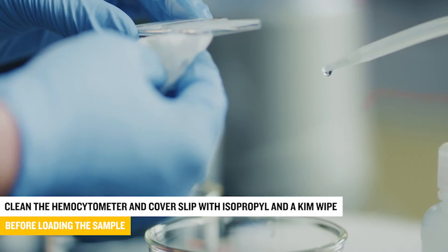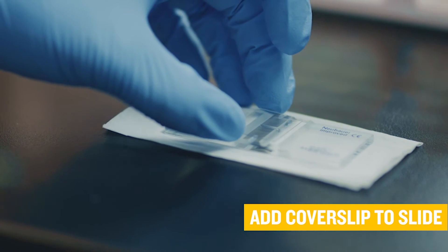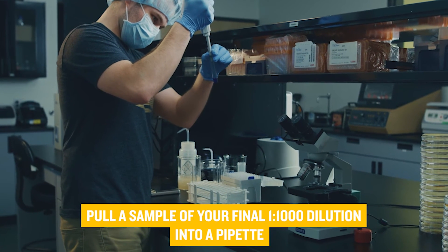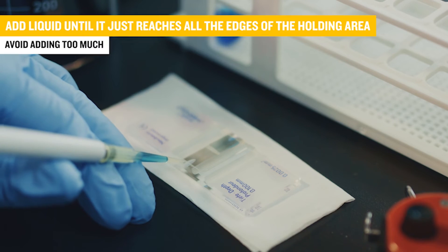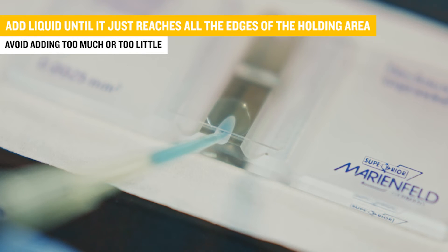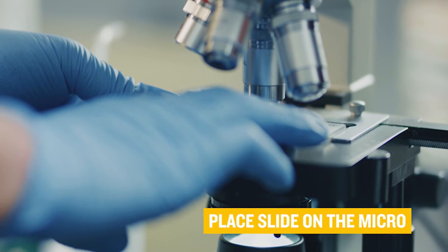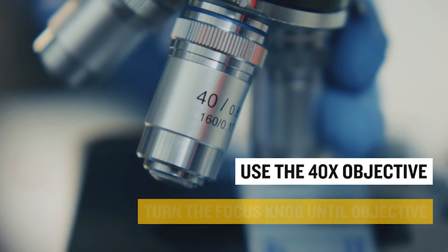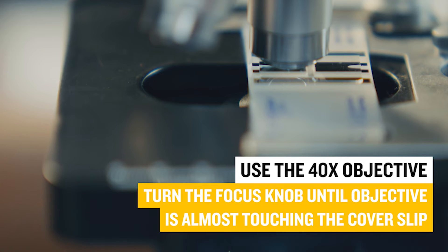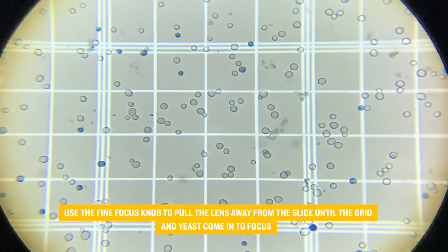First, clean the hemocytometer and cover slip with isopropyl alcohol and a kim wipe before loading the sample. Next, add a cover slip to the slide. Then pull your sample of the final 1 to 1,000 dilution into a pipette. Place the end of the pipette in the hemocytometer's loading area and add liquid until it just reaches the edges of the holding area, avoiding adding too much or too little. Next, place the slide on the microscope. Use the 40x objective and turn the focus knob until the objective is almost touching the cover slip.